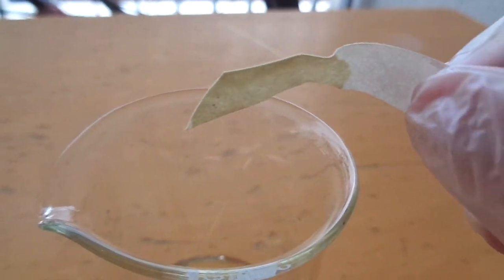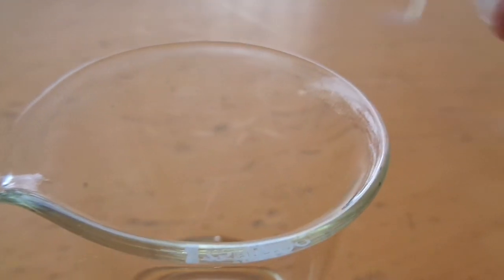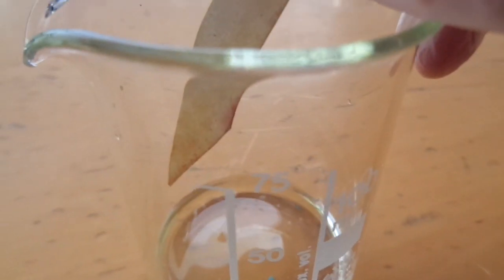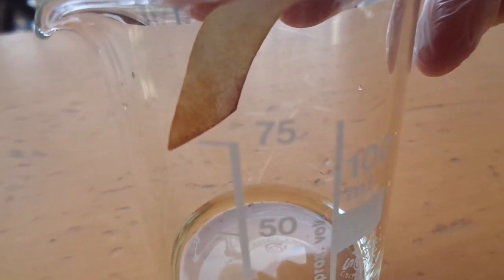But if I stick my paper near it... Maybe this side... Okay, I'm not sure... Yeah, you can see it changing colors. See?